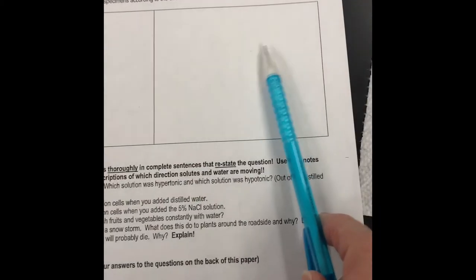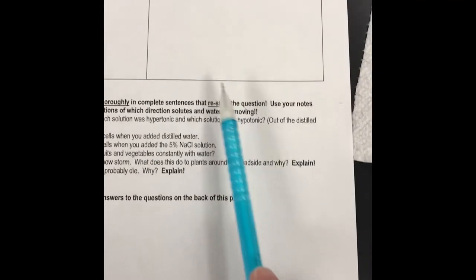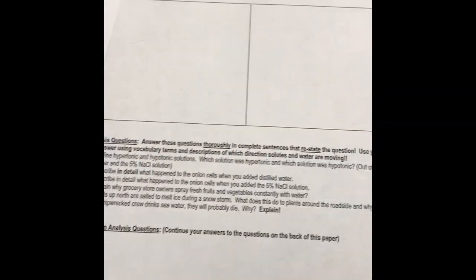Put that drawing over here, label it as salt water, and give me your total magnification. As soon as you make your drawings and color them, you need to answer the analysis questions.